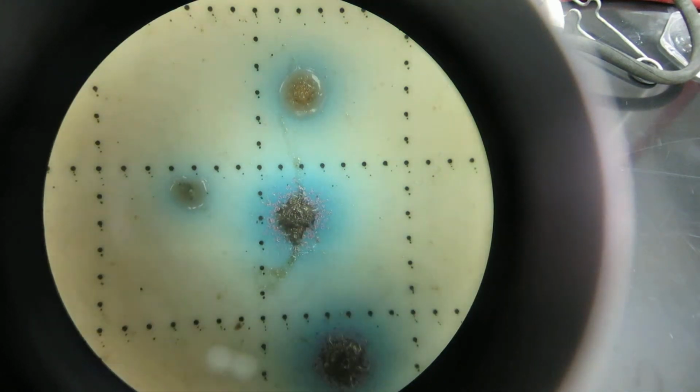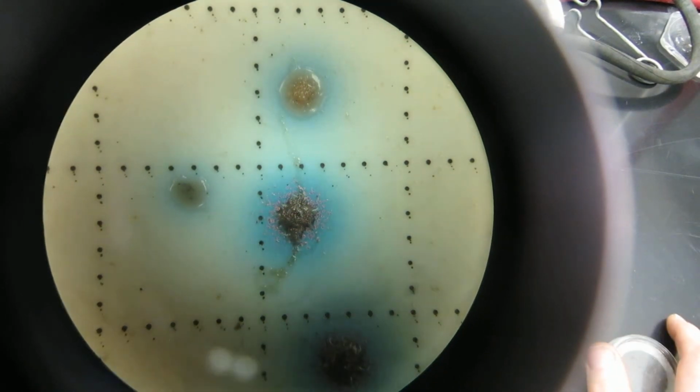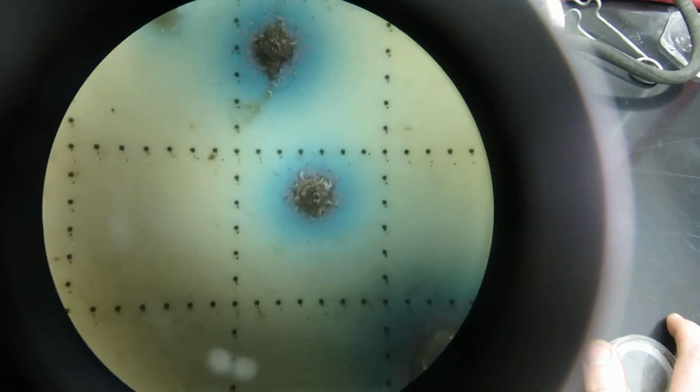Now there are other cases you can get, if it's confluent growth and it grows together and there are too many in one water sample. Then you can get a big problem and not be able to count them, and that would be too numerous to count. So for this particular sample, this is 10 to the negative 2 from some stormwater out in Santa Monica. And this was on December 2nd, 2014. There was a storm there.